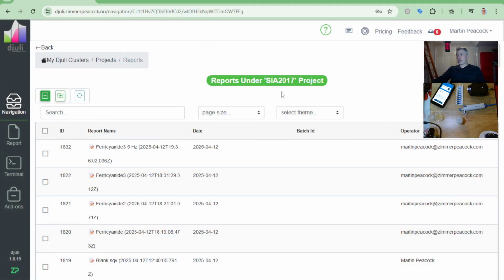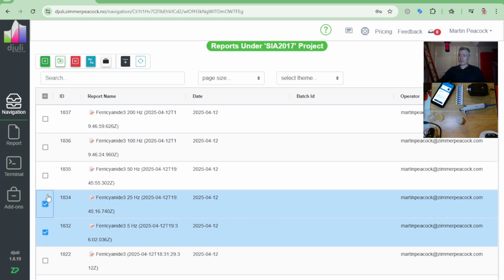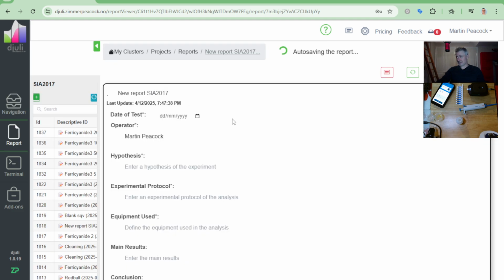I'll do a quick refresh. Right, so there's my 5 hertz. Let's see what pops up now. Right, so there we got my data, so I'll overlay it. So let's take the 5 hertz, the 25 hertz, the 50 hertz, the 100 hertz, and the 200 hertz, and we will combine it in one report, which I am doing. Hopefully I've hit combine. Yeah, here it goes.